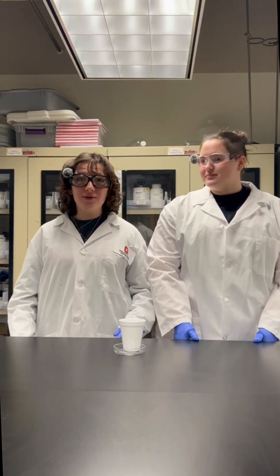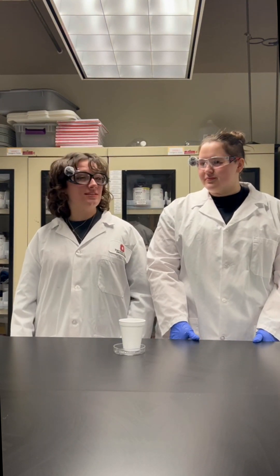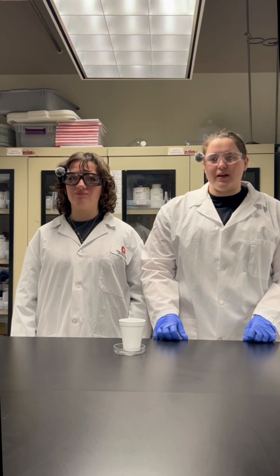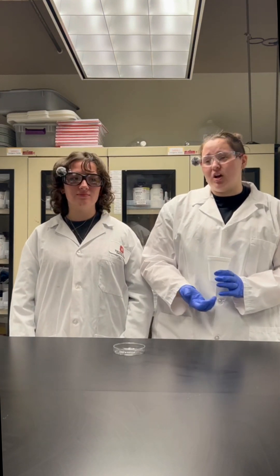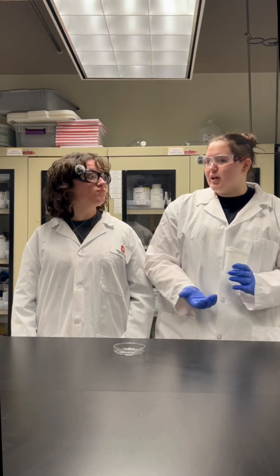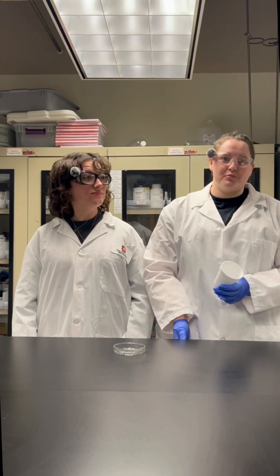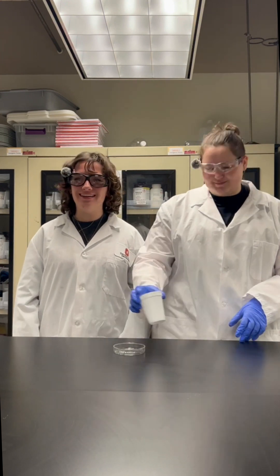But what if we want to go backwards and separate these polymer chains? Well, it depends on the substance in question, but in the case of this styrofoam cup, the chain can be dissolved with something as simple as acetone, aka nail polish remover. That sounds cool — let's try it.